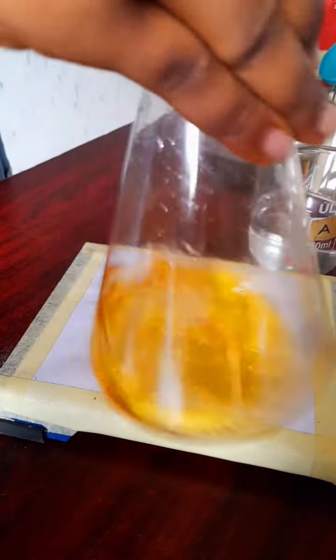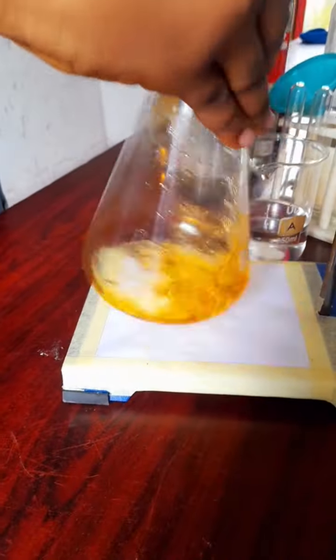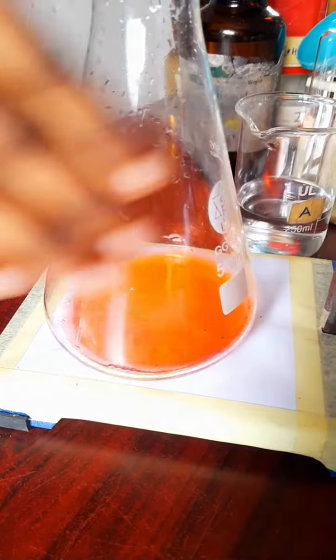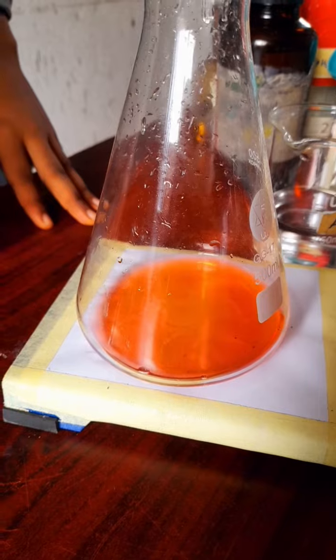So we titrate one more time, hoping that our consistency would be good enough. All right, so waiting for the end point. Remember to swirl well until you meet a color change, which is about now. All right, so swirl well to make sure that the color mixes up, so you're not deceived by a slight color change. You need a consistent color change.